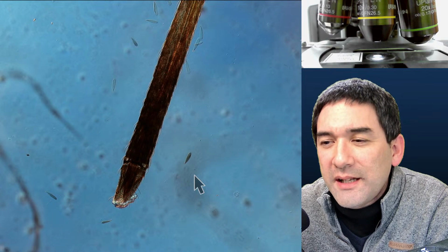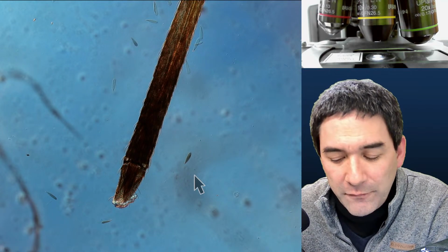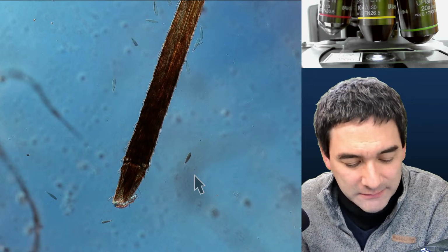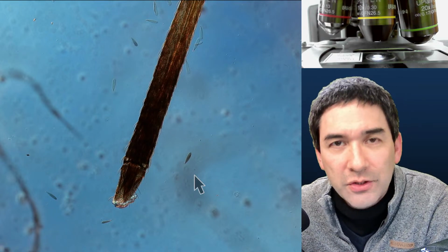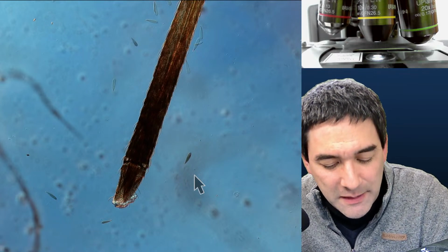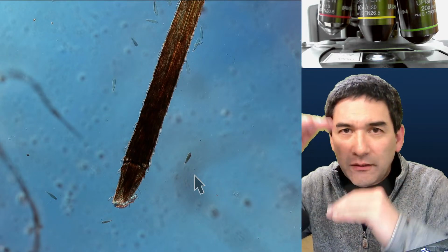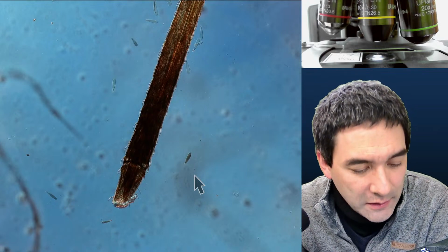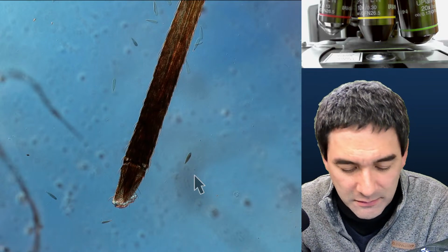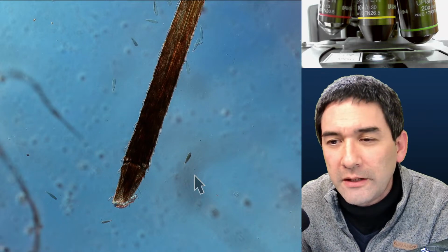How come your insects are so beautiful and not crushed by the flat slide? First of all, some of them are a little bit crushed, so that's one thing. And sometimes you might not see this: the specimen is so thick that the cover glass is not really flat, but kind of lifted up. Not ideal, but I would say that the commercial ones are probably even a little bit better.